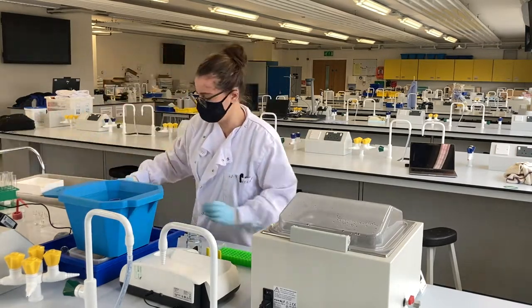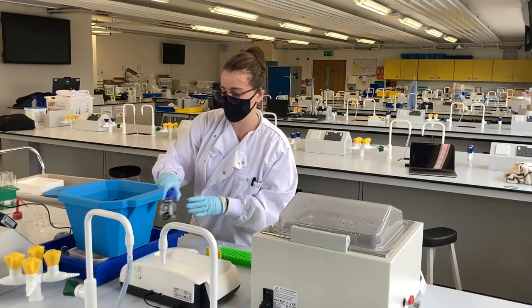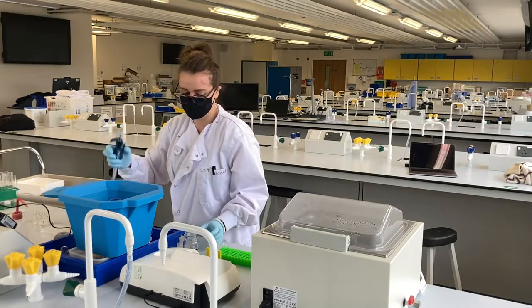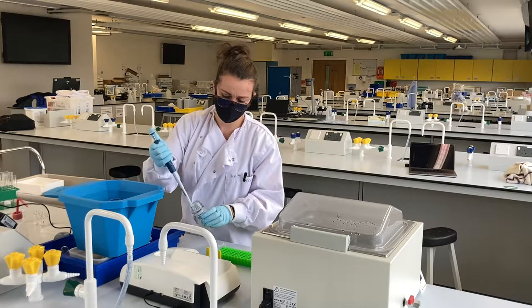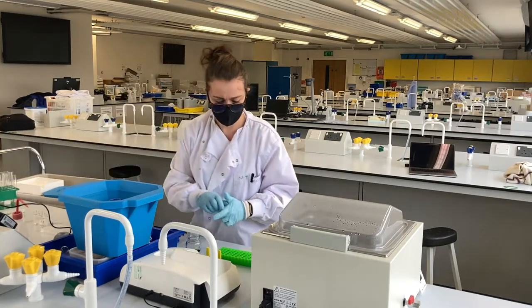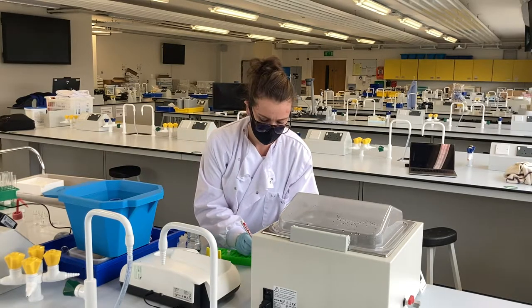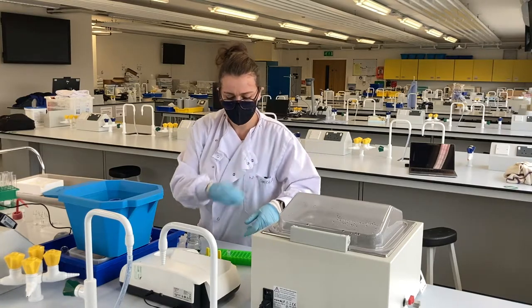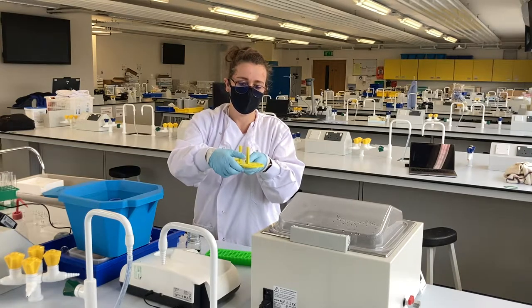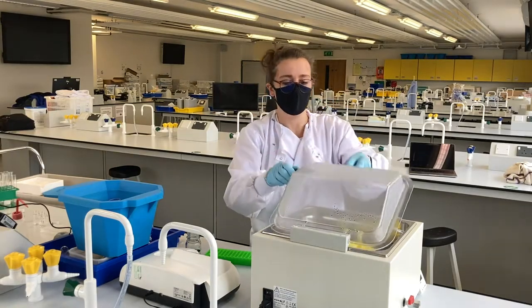You can keep your enzymes and your substrate separate until you're ready to start the reaction. These go into separate Eppendorf tubes, which then go in a floaty rack. We place them in the water bath at the desired temperature for a five-minute incubation before we use them.